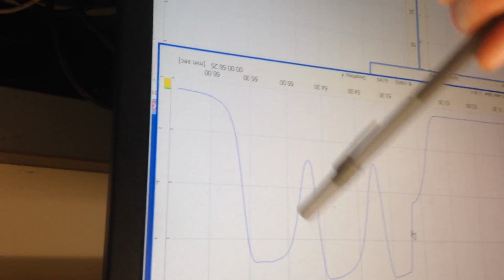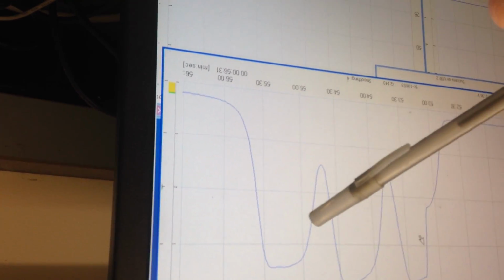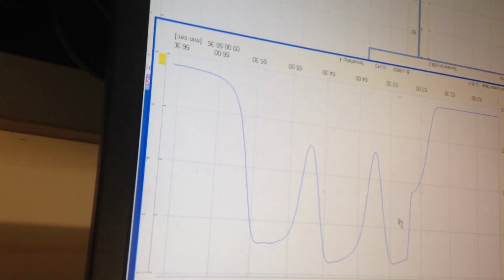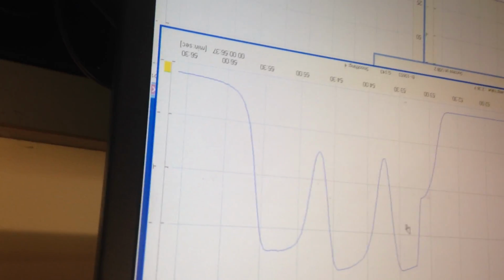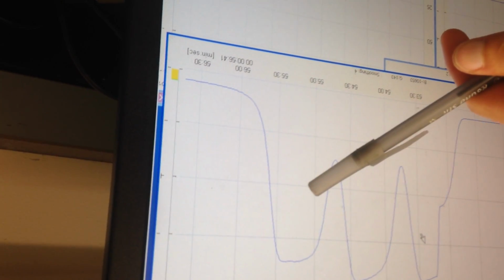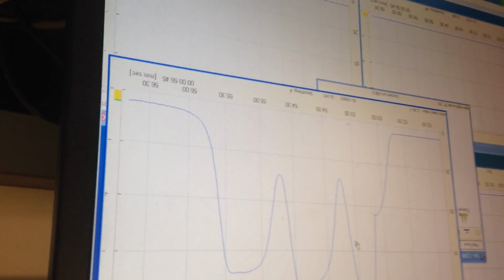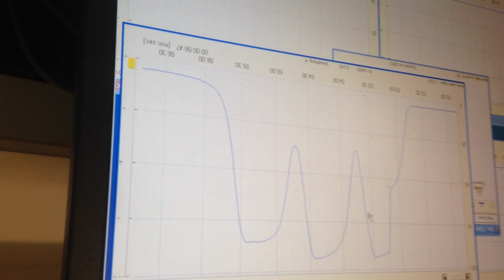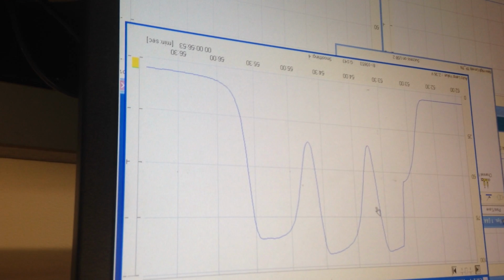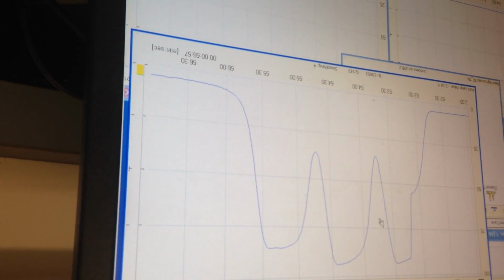And sometimes you will see a difference between the spikes in the 910 cup versus the 901 cup. But they shouldn't be that big. Like you shouldn't have these two and then one down here. I think that's a reasonable. Yeah. Okay. So now we're just waiting for the baseline to get back to stable, and then we can start the run.